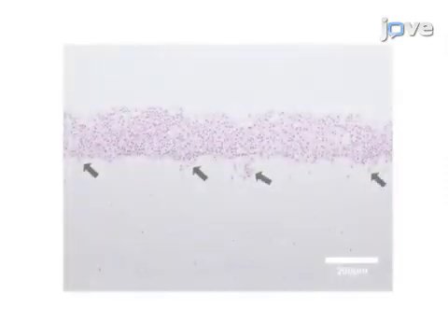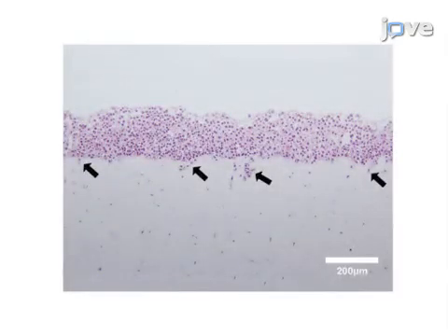Ultimately, histological examinations are used to evaluate cancer cell invasion and morphological changes.